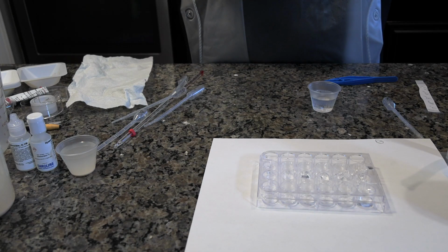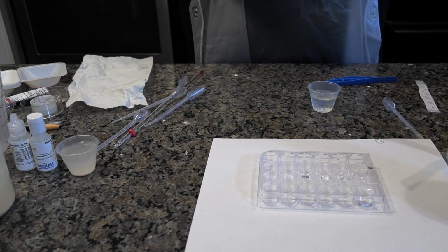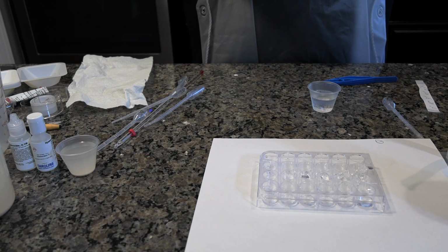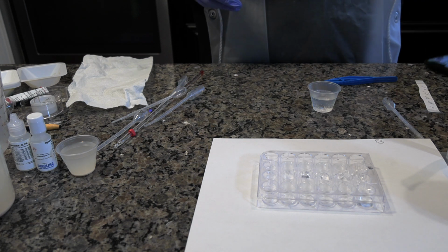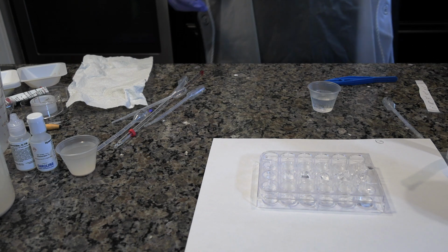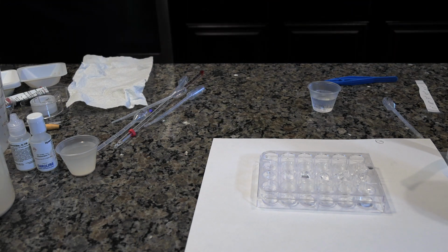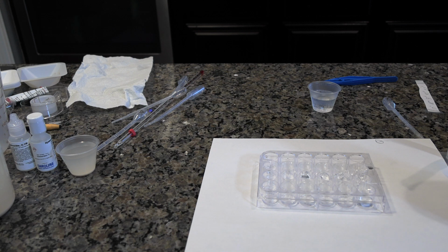Perform 2 additional trials with a new soaked disc from well B1. Conduct 3 trials of each of the remaining solutions, B2 through B5 and D1 through D5. Swirl the well plate to mix the solution before wetting the disc. Start with the lowest pH and move to each higher pH.